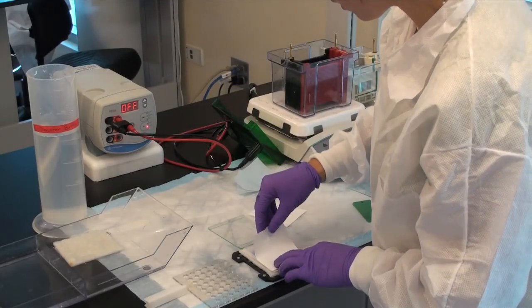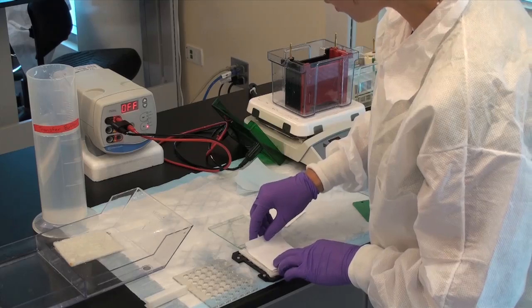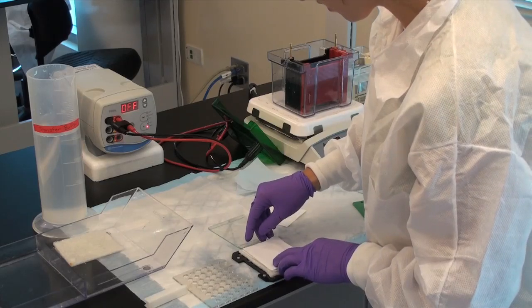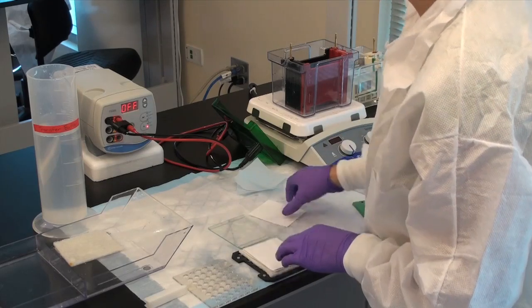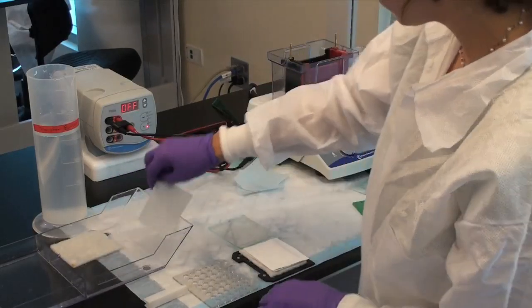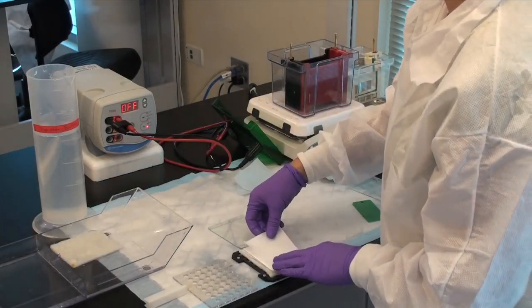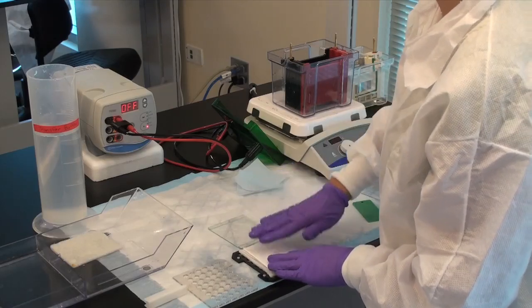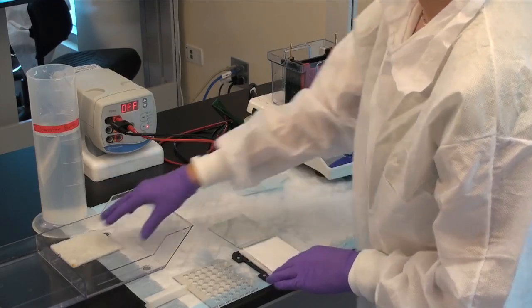Membrane, gently smooth out to remove bubbles. Filter paper, and sponge.